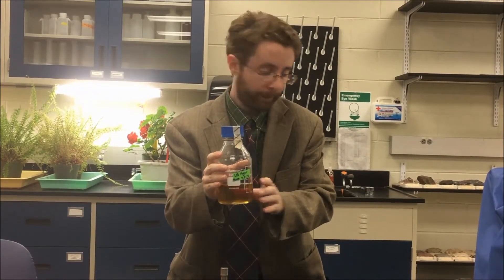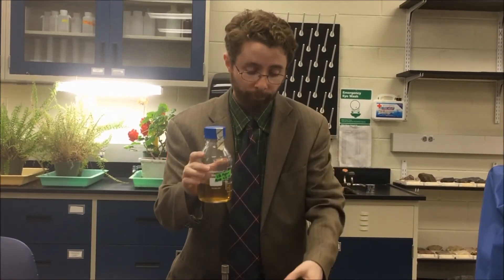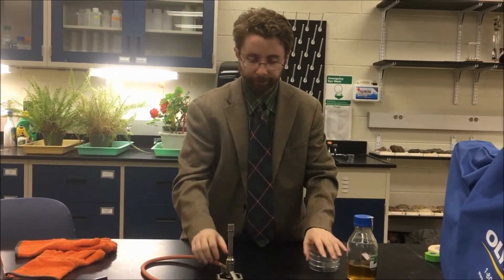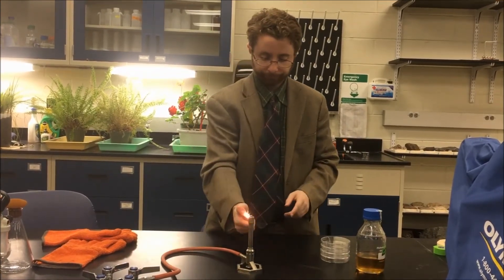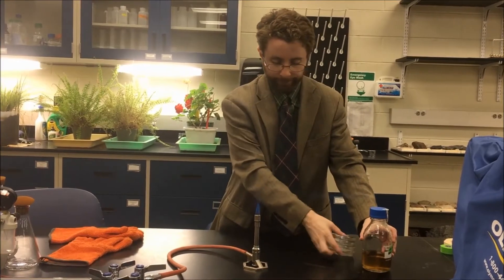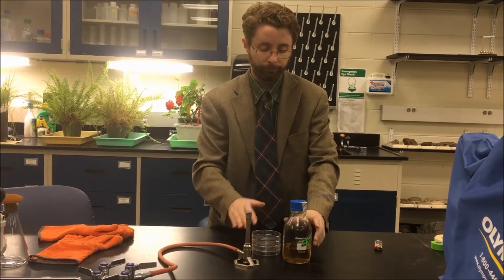We now want to transfer this into our plates. We'll begin by setting up a sterile area using the Bunsen burner. I'll turn on the gas and light it. To make sure that this media stays sterile, I'm going to work as close to the flame as possible.